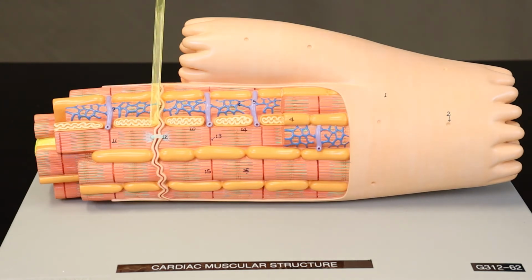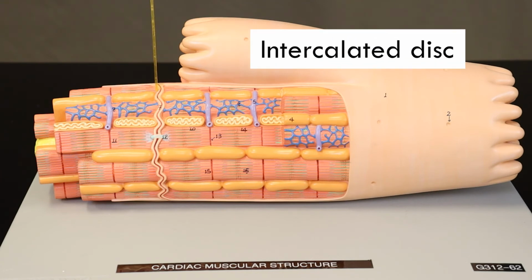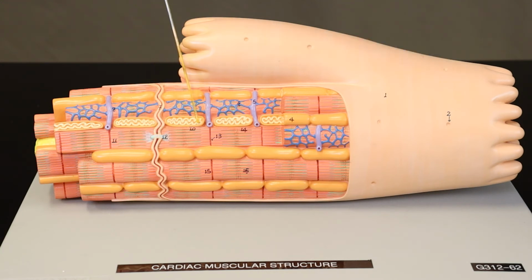The gap junctions occur at the boundary between two heart muscle cells, cardiac muscle cells. That boundary leaves a distinctive wavy line here that we call the intercalated disc. The intercalated disc allows the two cells to interleave with each other.